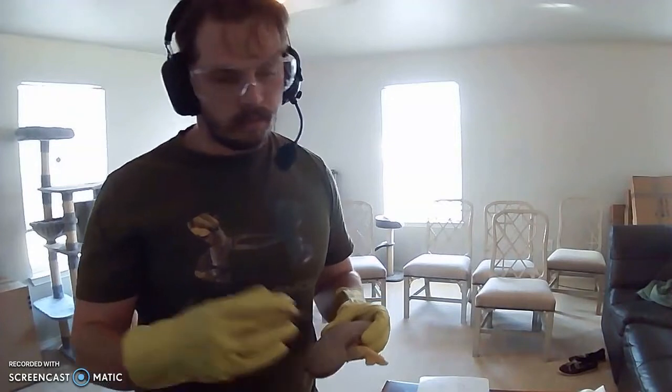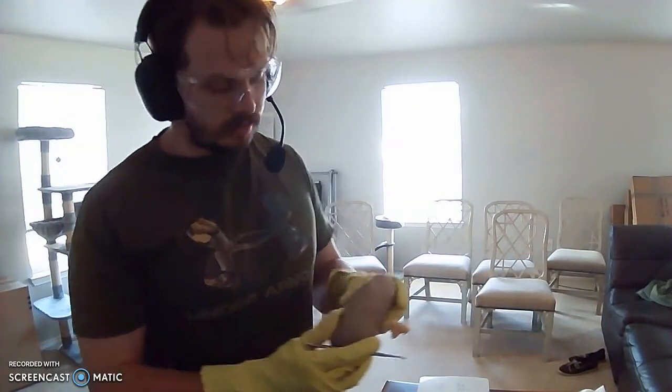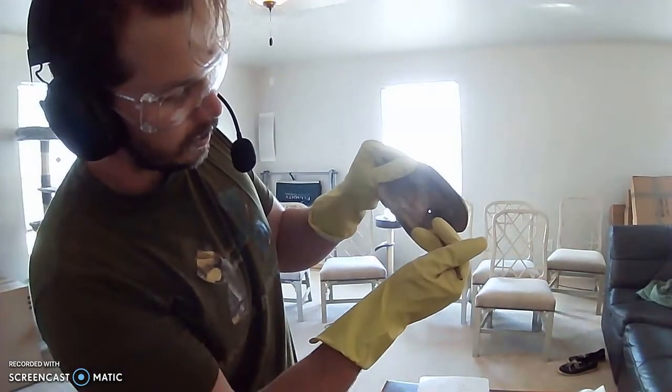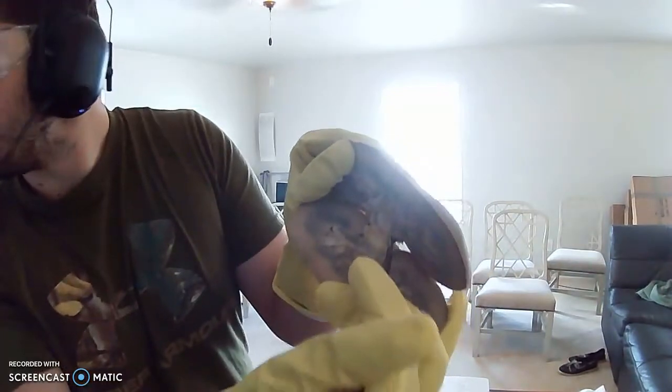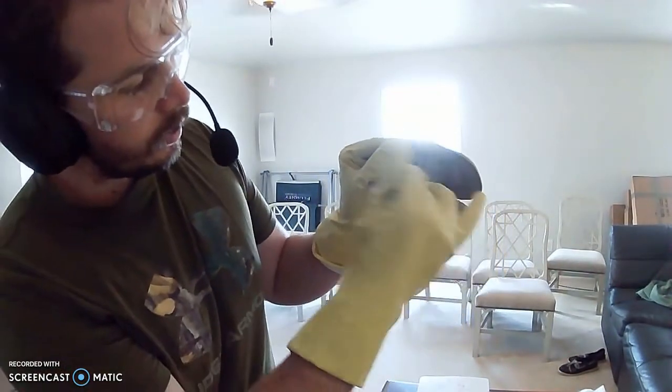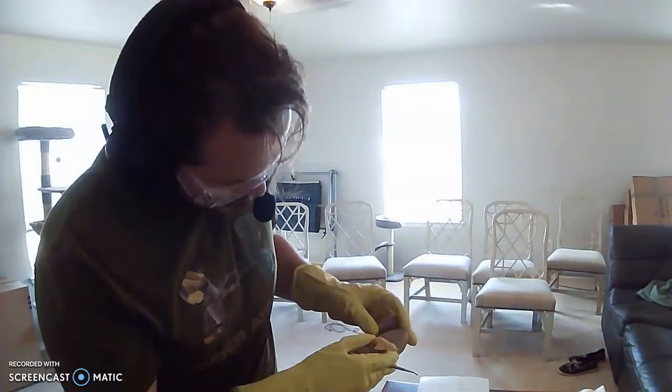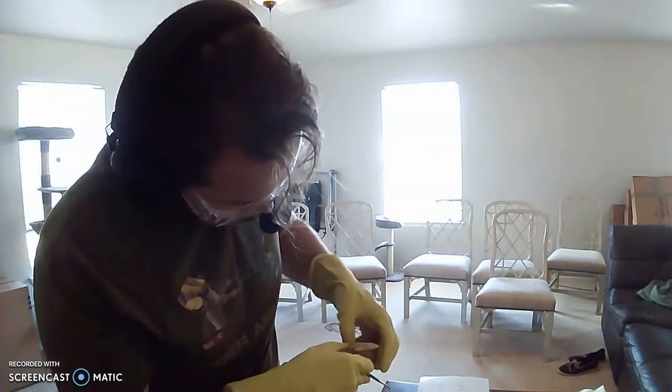This is places for blood vessels, for lymphatic vessels. It's just kind of some spaces for such. And they kind of would be behind this little stretch of tissue I have here, all inside of here. And I do have a slice that should help show one, if I can get to it.